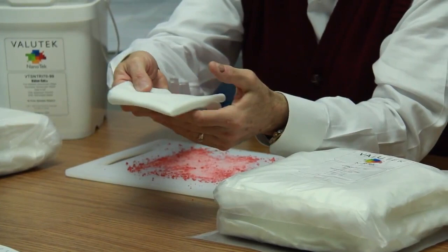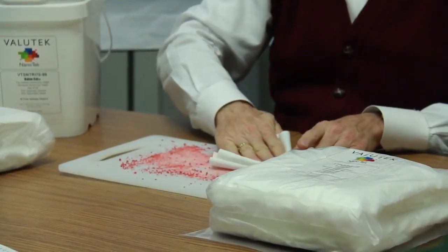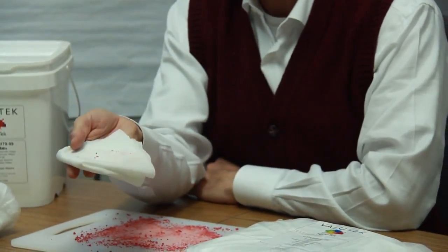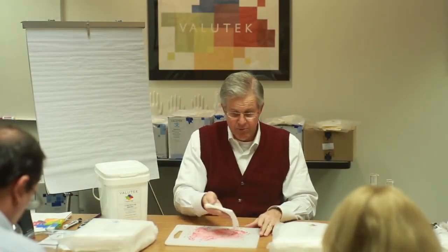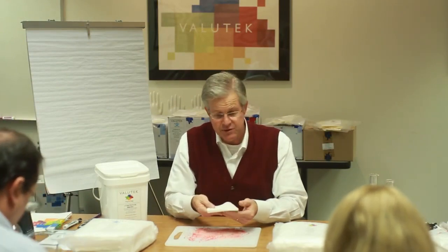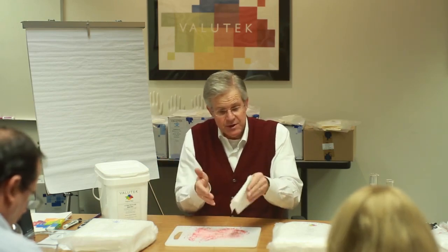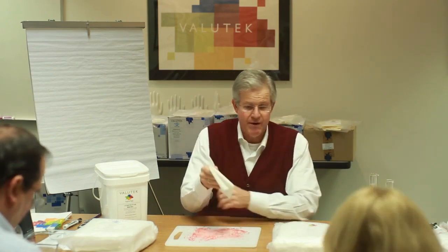What I'm going to illustrate is what happens when you take a dry wiper and you go to wipe a surface clean. What you see is that very few of the particles cling to the wiper. Really, I've just moved around the particles. I've dispersed the particles because a dry wipe doesn't have any coefficient of friction. There's just a little texture on this wipe that causes some of the particles to be trapped, but the particles aren't going to cling to the wipe. And as you can see, as I shake the wiper, all the particles are going to come off.